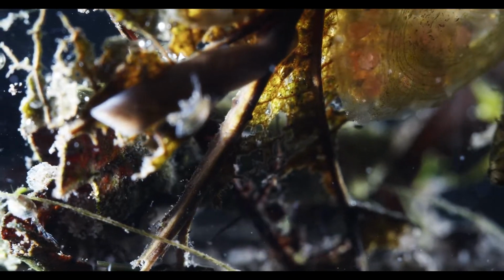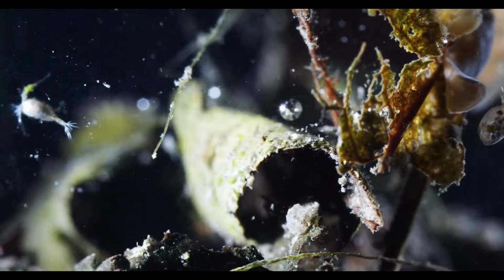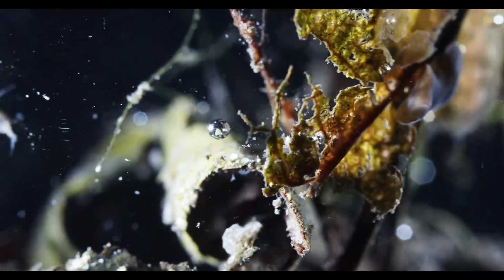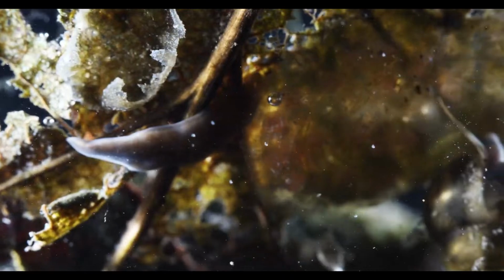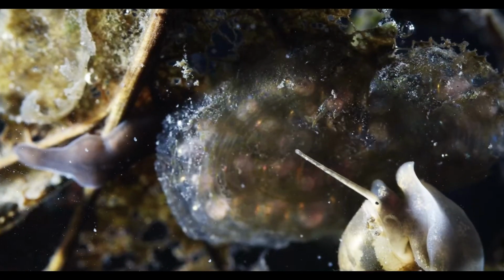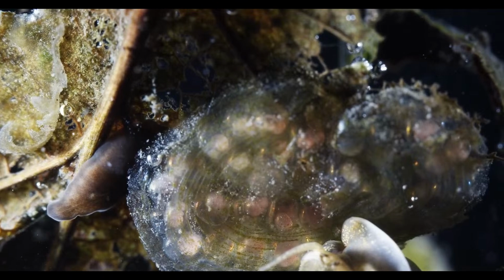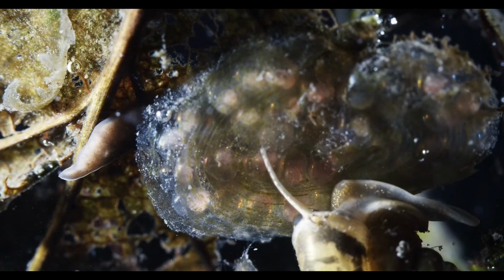I think I said it before I started the stream, but copepods, for example, I've seen them in agricultural ditches that have an algae bloom in winter and are sun-baked in summer. It's an odd shape. Contracting, the flatworm? What is he doing? He's up to no good, I'm sure.